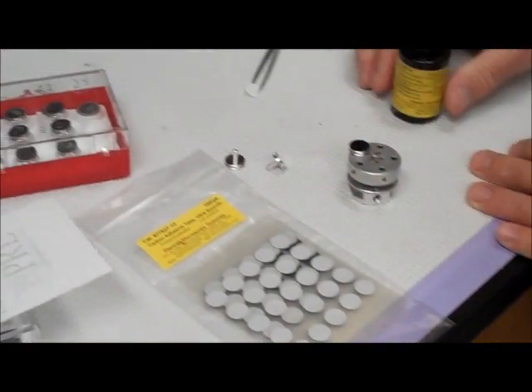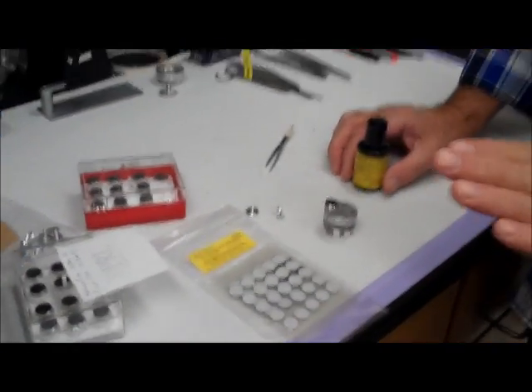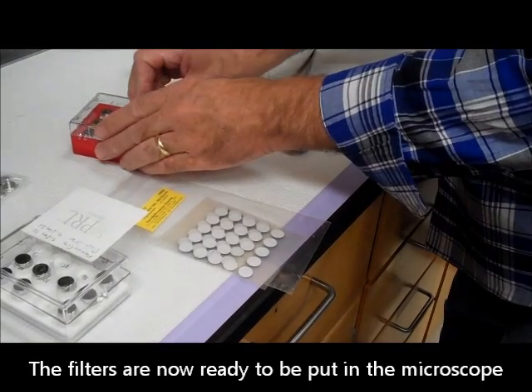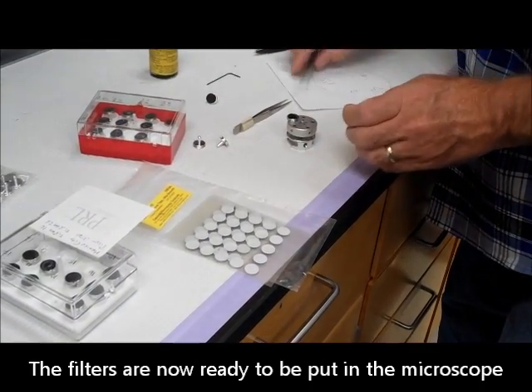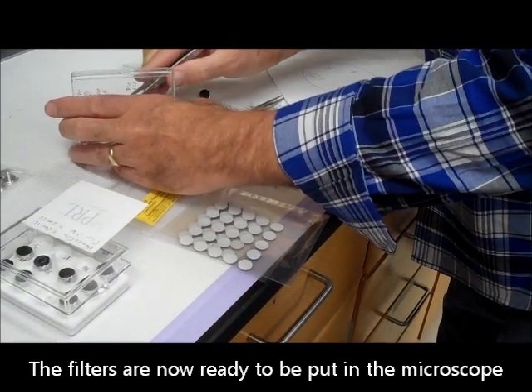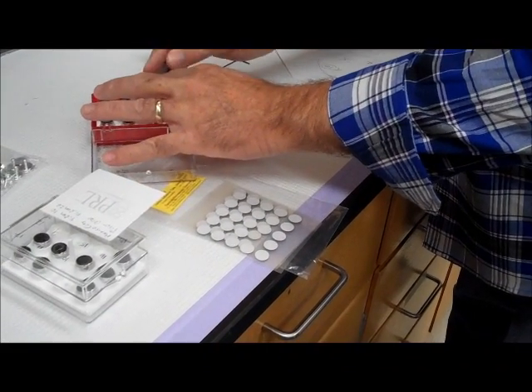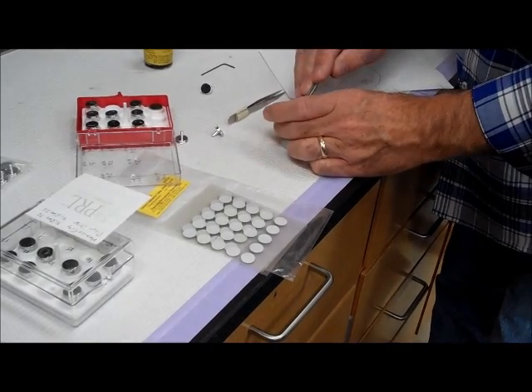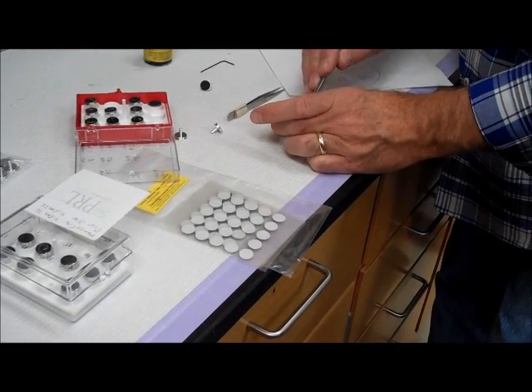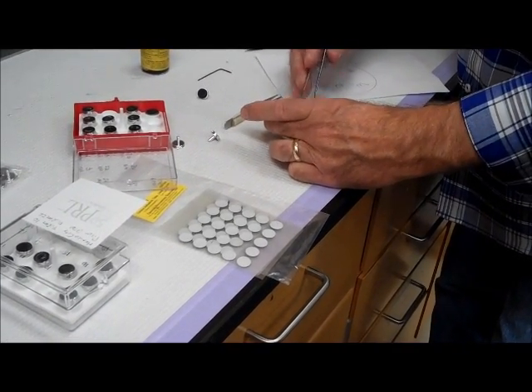And then it has to be coated. And then we want twenty-six, right, so then we'll pull twenty-six out, and we'll put it in position two, like that.